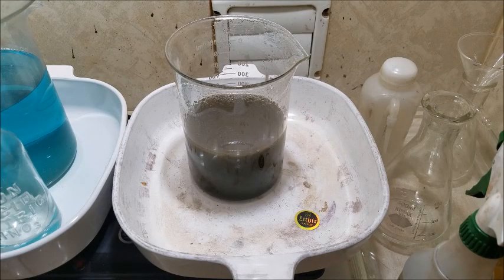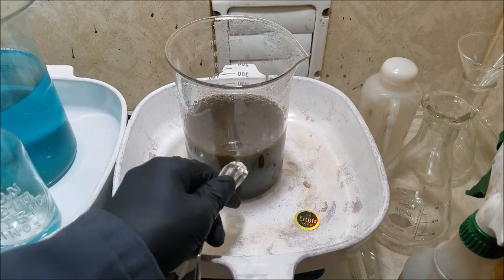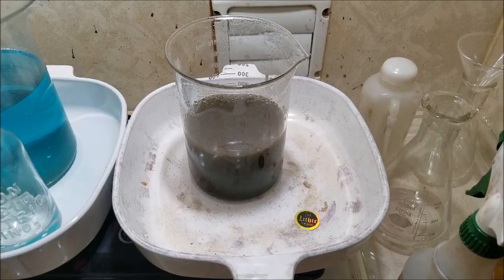However, if I bend down and look level with this, I'm starting to see a line right here of very clear fluid, which is an indicator, on a normal batch, that the gold has dropped out of solution. So let me get some filter paper here, or test strip.